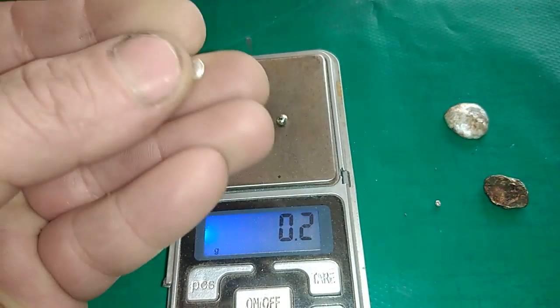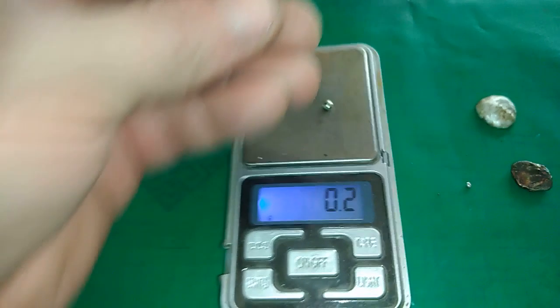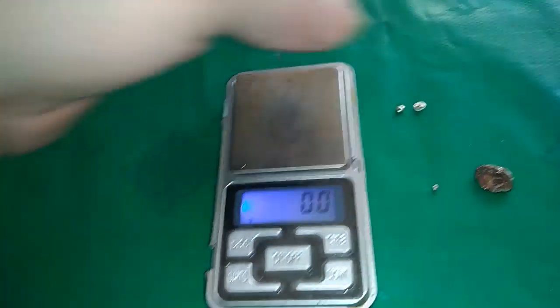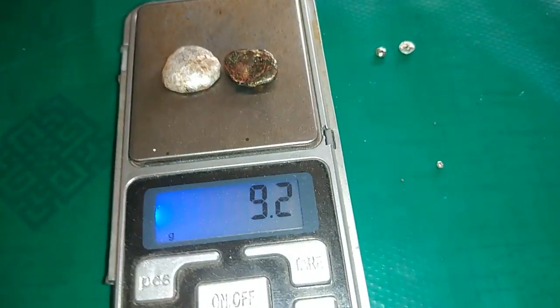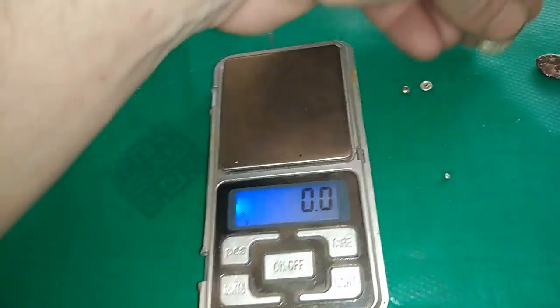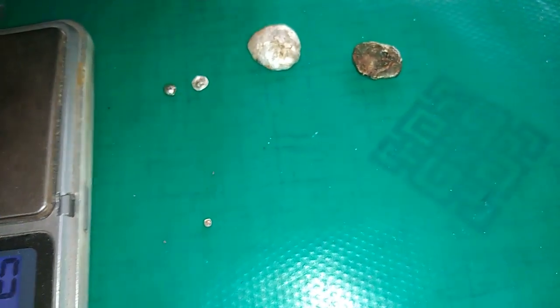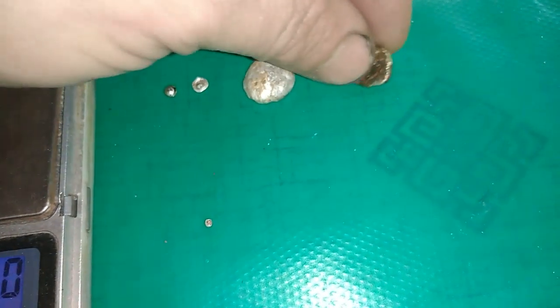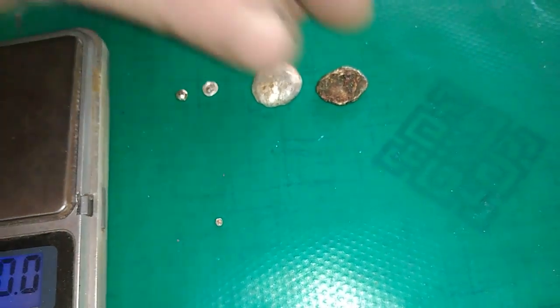But from this — from the MLCC from this video — it's only 0.2 gram of palladium. And together I have 2.9 gram of silver. Not bad. So what I'm going to do right now — I will take that silver and this palladium, drop that in hot HCL for some time, and remove all that borax and all that dirtiness.